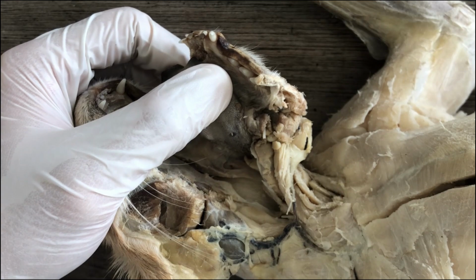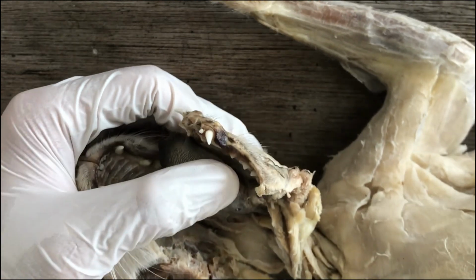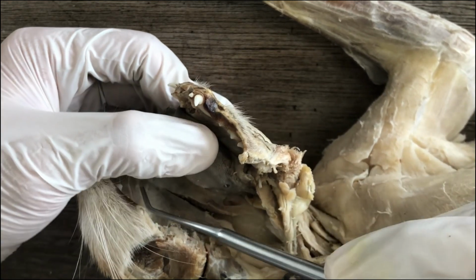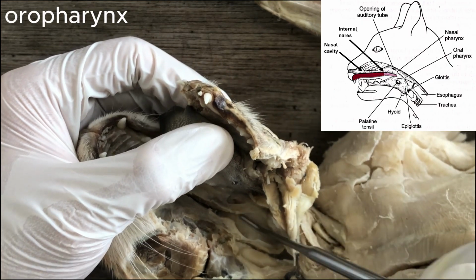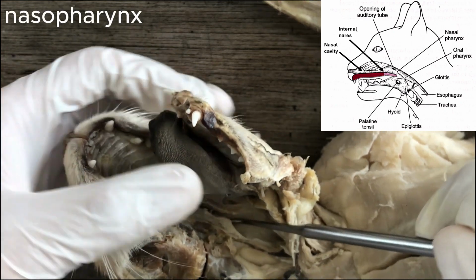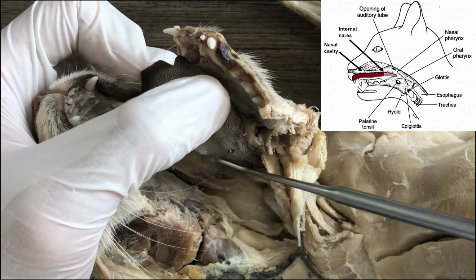If you move posteriorly, you are now in the domain of the pharynx, and the pharynx, due to the evolution of the palate, has been partitioned into at least 2 compartments. So the part continuous with the oral cavity is the oropharynx. And the one dorsal to the palate is the nasopharynx, continuous with the nasal cavity. Makes sense, right? Their names. So this would be the nasopharynx, and this continuous with the oral cavity is the oropharynx.